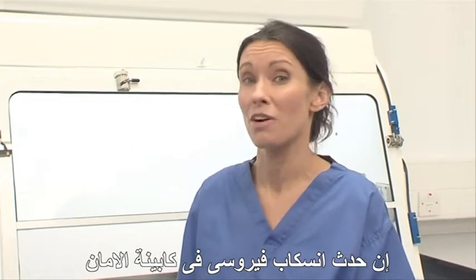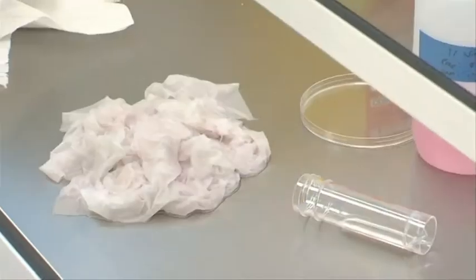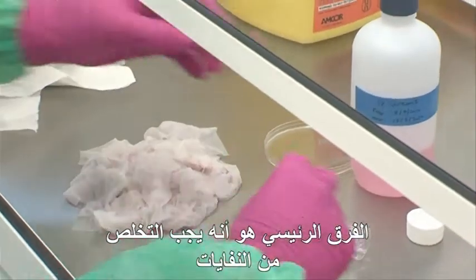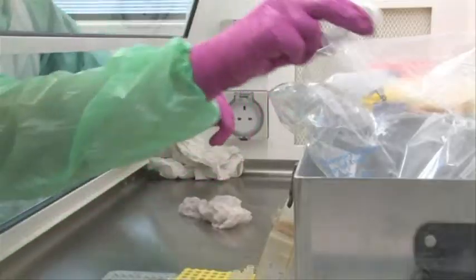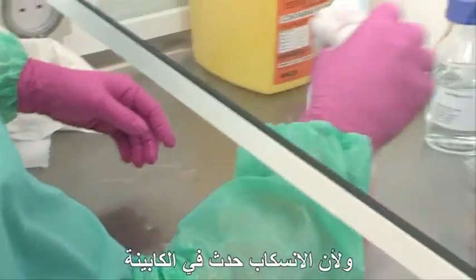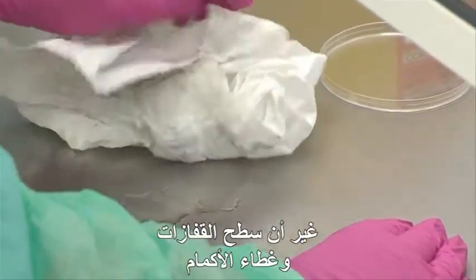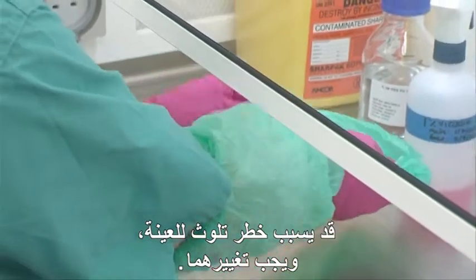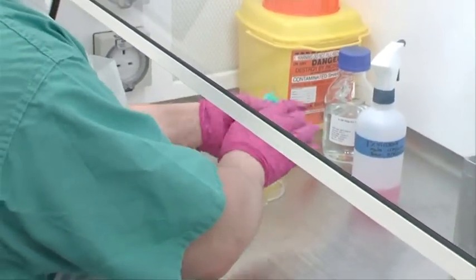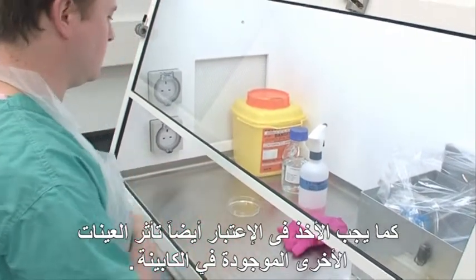If a spill with any virus occurs within a safety cabinet, much the same procedures for a Category C virus spillage apply. The main difference is that waste material should be discarded in the tin or bag within the cabinet. Because the spillage is contained within the cabinet, there is less risk of aerosol release to the environment, although outer gloves and oversleeves could pose a contamination risk to the sample and should be changed. Risk to other samples within the cabinet should also be considered.